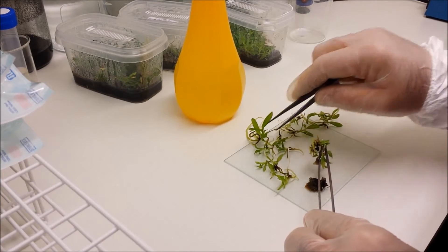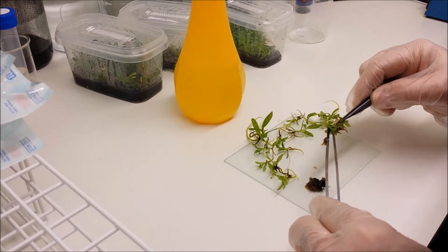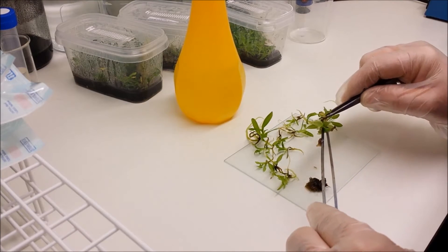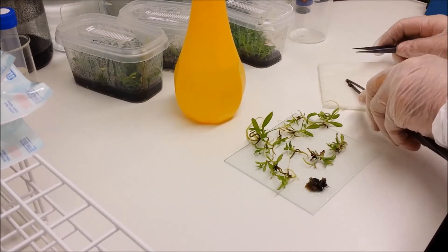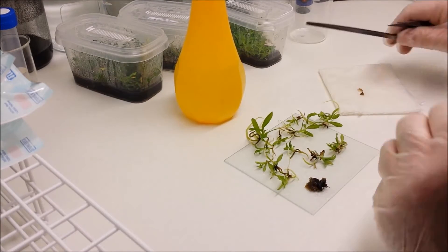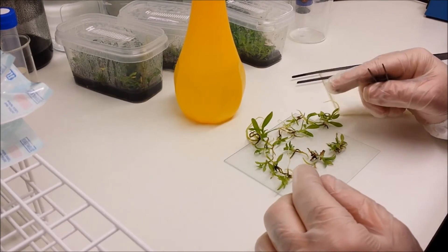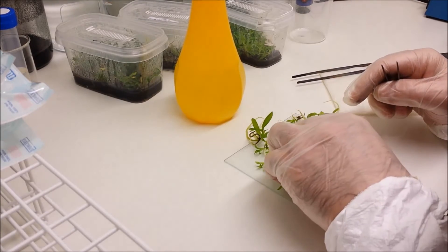These seedlings I would think would take probably something approaching five years before they actually become a flowering size plant. So you need to be quite patient. Any old media that sticks to your utensils, just wipe it on your sterilized tissue paper.